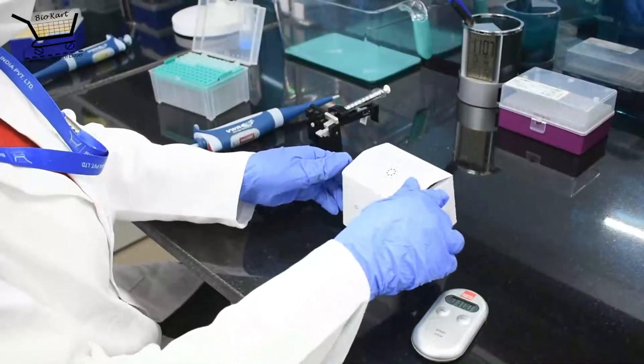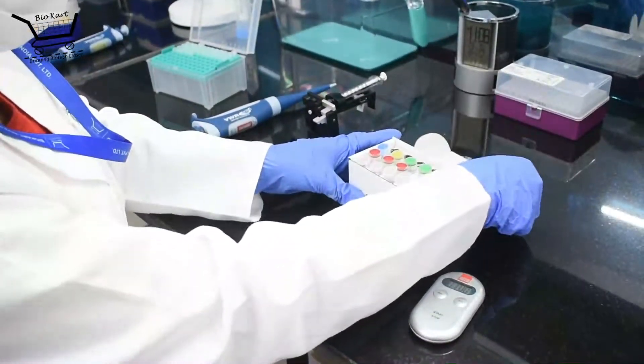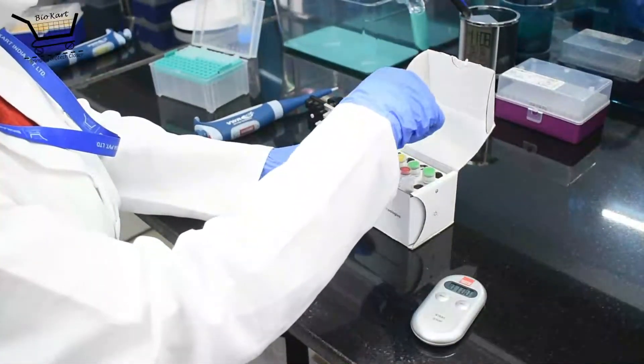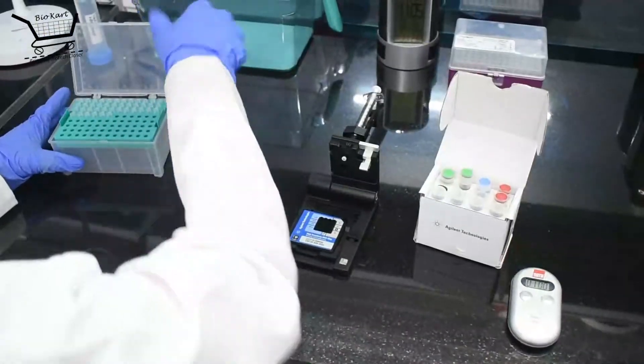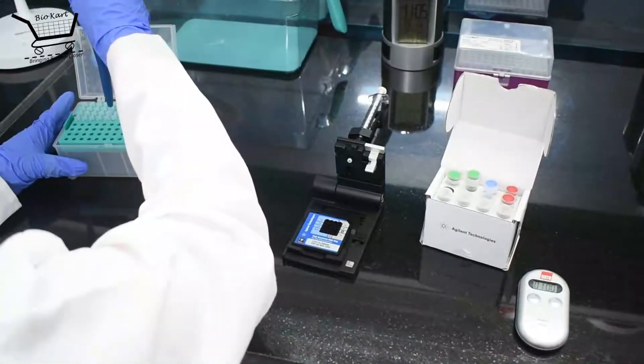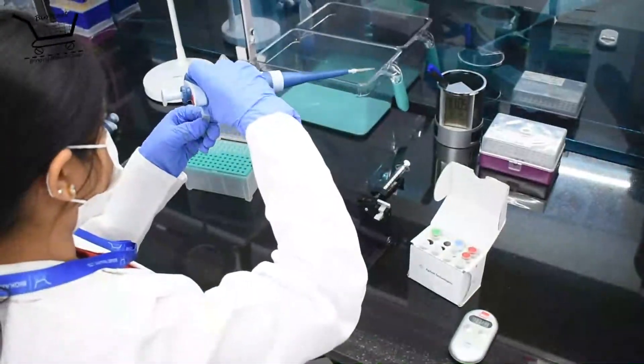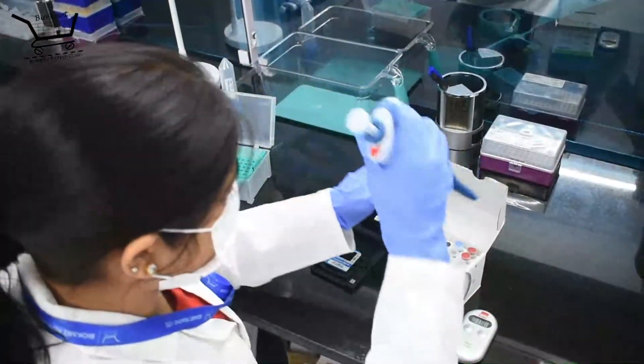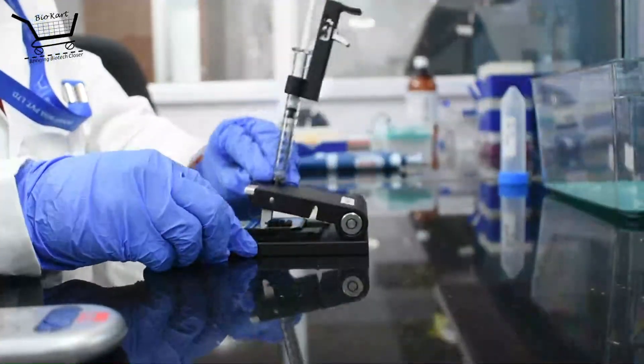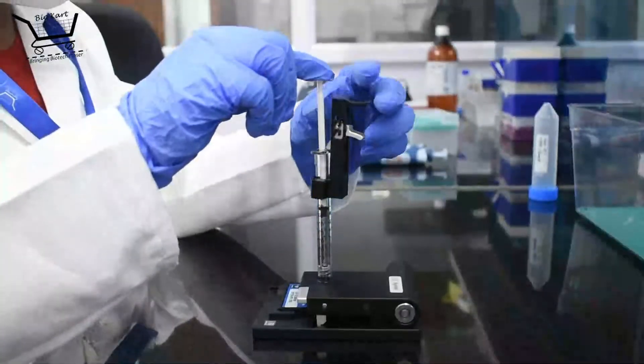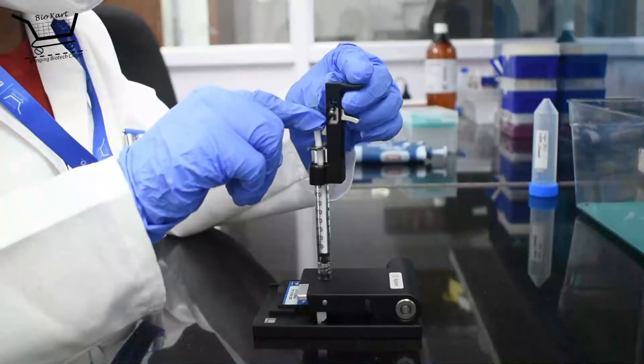After the stages of purification and QC for the barcoding PCR product, the library is deemed ready of that particular sample. We then perform individual bioanalyzer profiling for each sample. The brief steps involved are priming of the DNA chip, loading of libraries into the DNA chip, running it on the bioanalyzer.